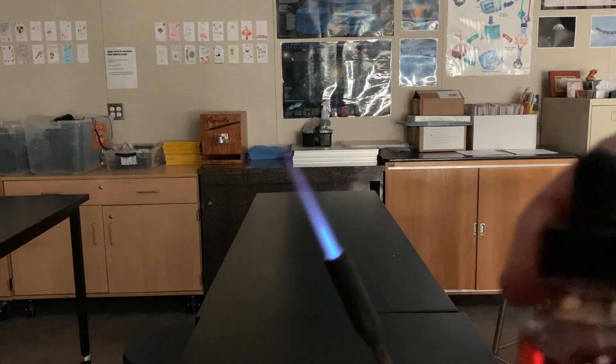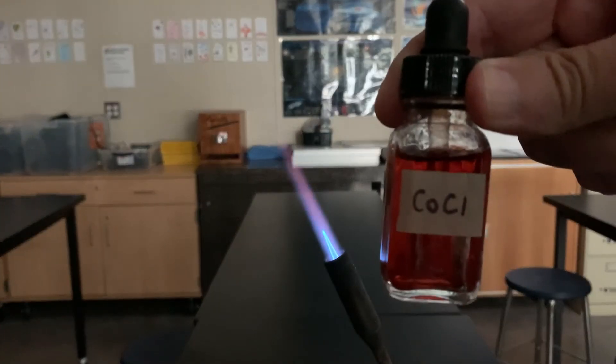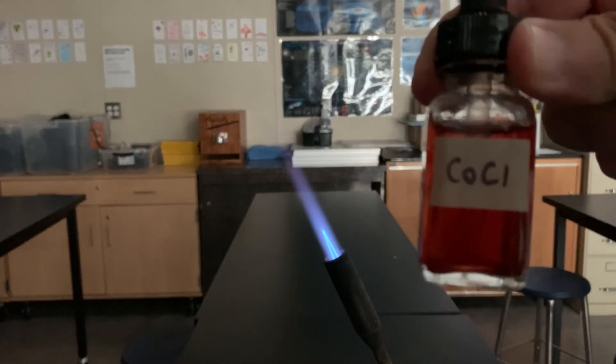The final one I have to show you is a chemical called cobalt chloride, which is a beautiful reddish liquid.